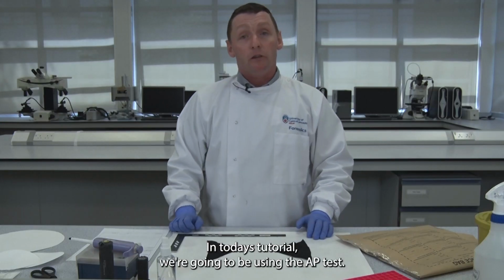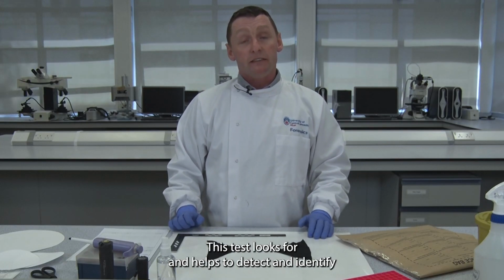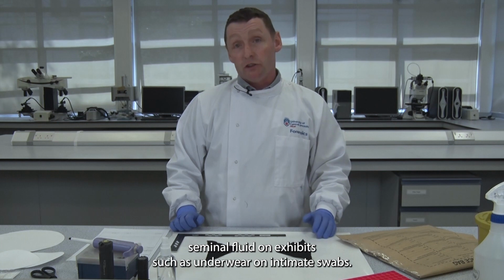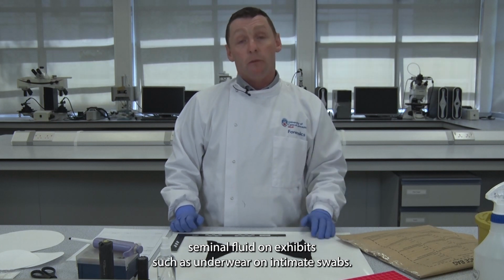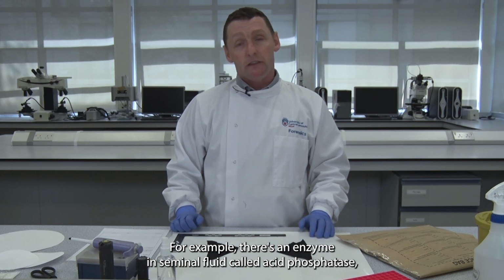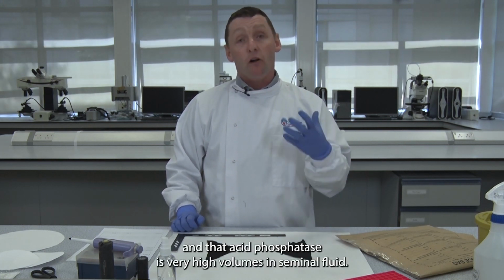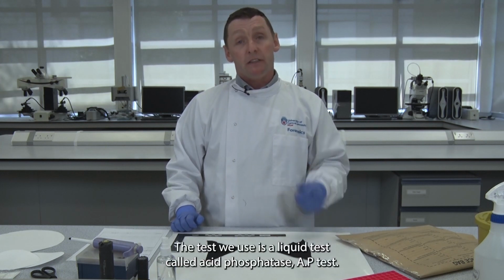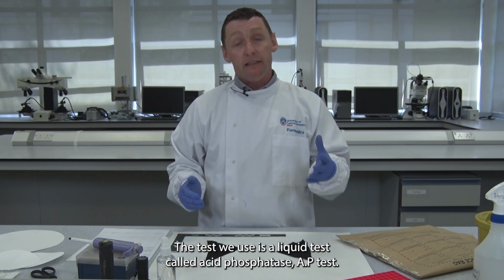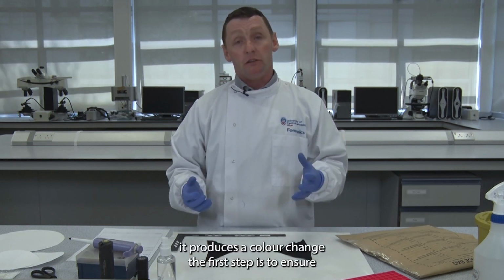In today's tutorial, we're going to be using the AP test. This test helps to detect and identify seminal fluid on exhibits such as underwear and intimate swabs, for example. There's an enzyme in seminal fluid called acid phosphatase, which is present in very high volumes. The test we use is a liquid test, the acid phosphatase AP test, and in the presence of the enzyme, it produces a colour change.